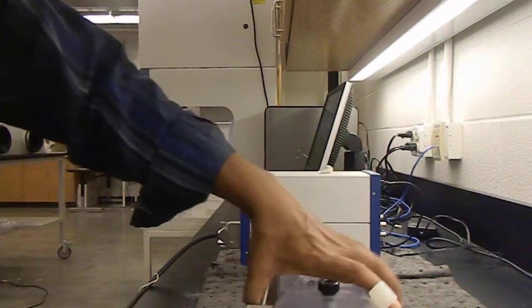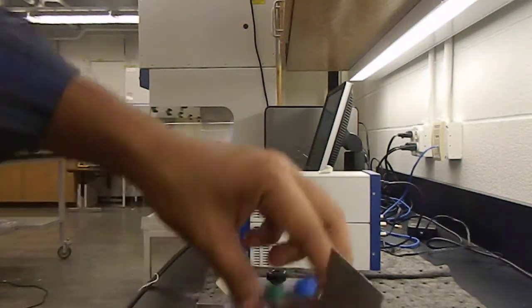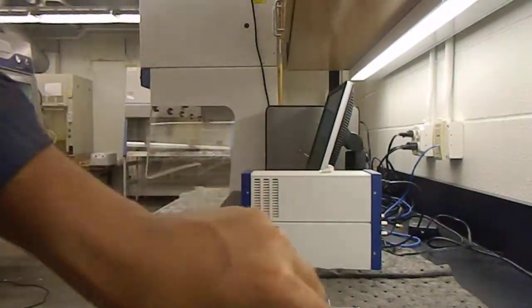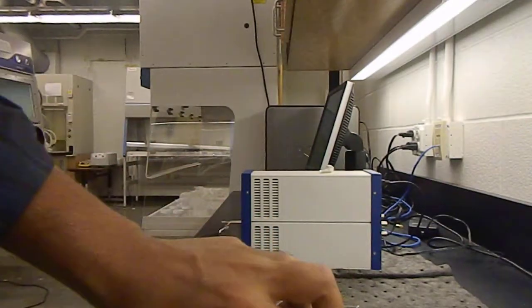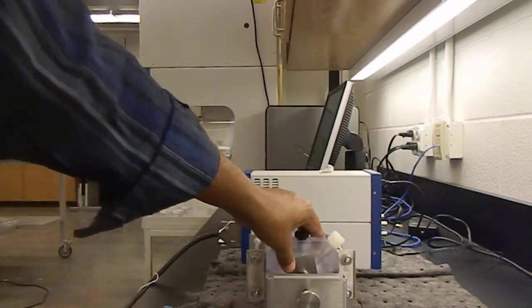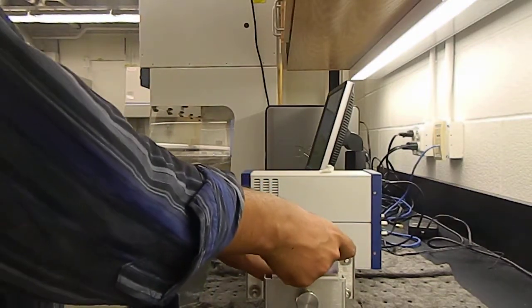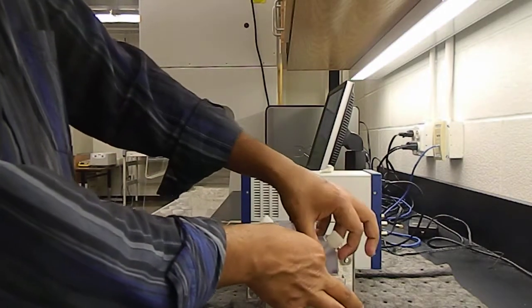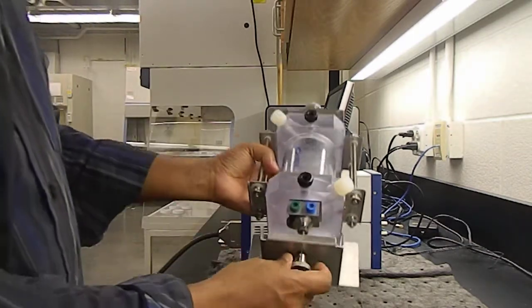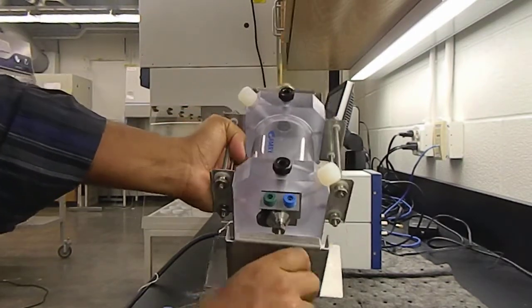Okay, so what we are going to do here is, see, this way, and we have to... Okay.